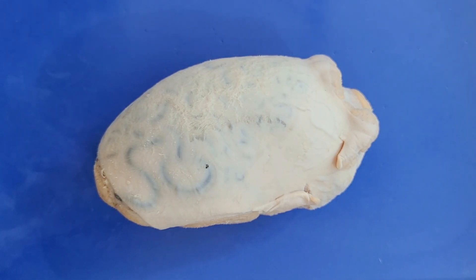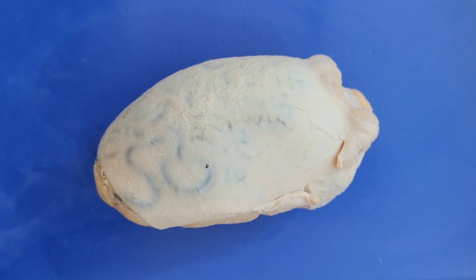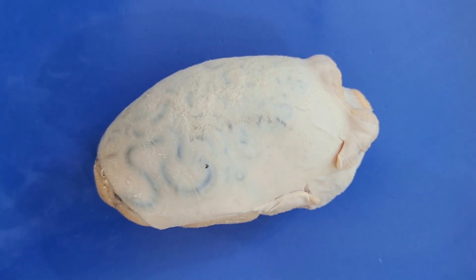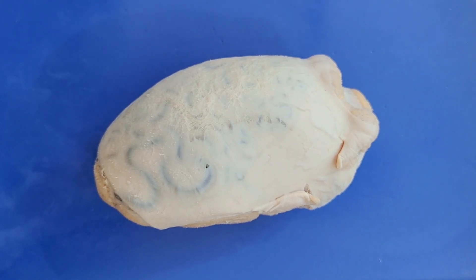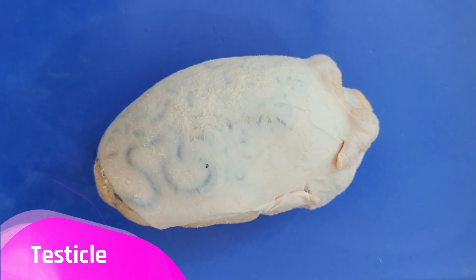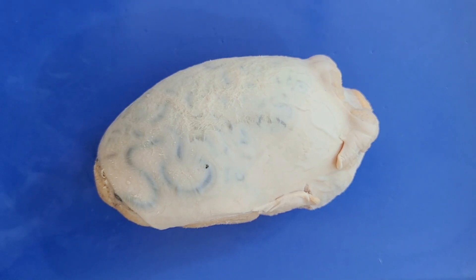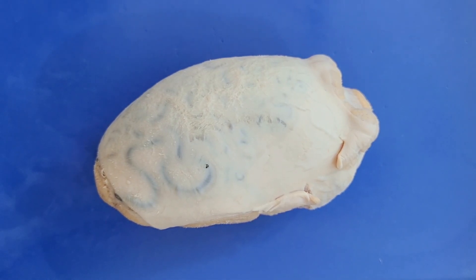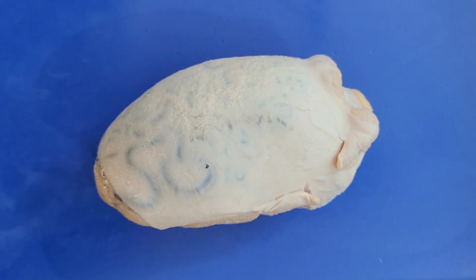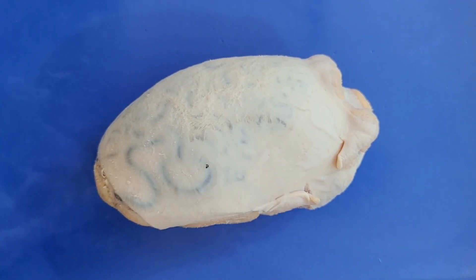In this video we'll be talking mainly about the testes, because the specimen here is of the testes. What we refer to as the testicle usually includes the testes, the epididymis, and the vas deferens. While we can't see these other structures in the specimen, I'll still talk a little more about them later on.